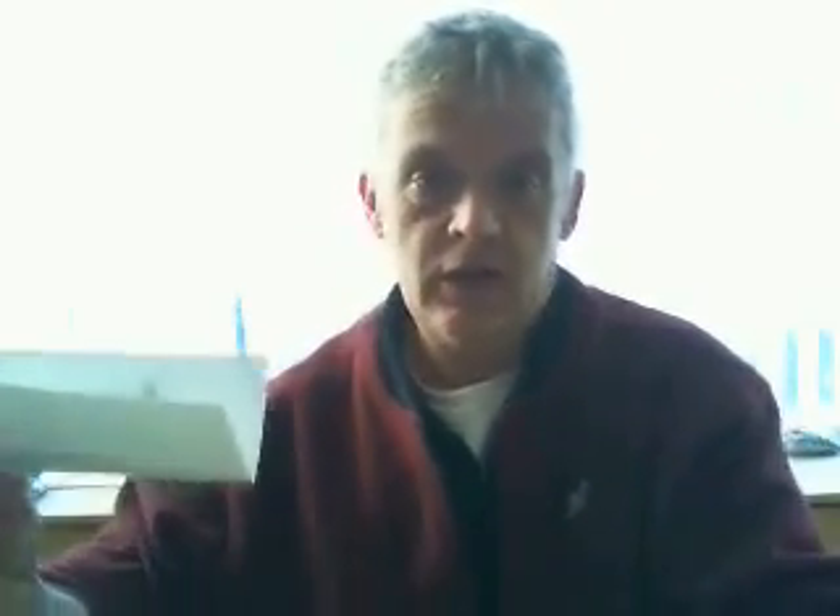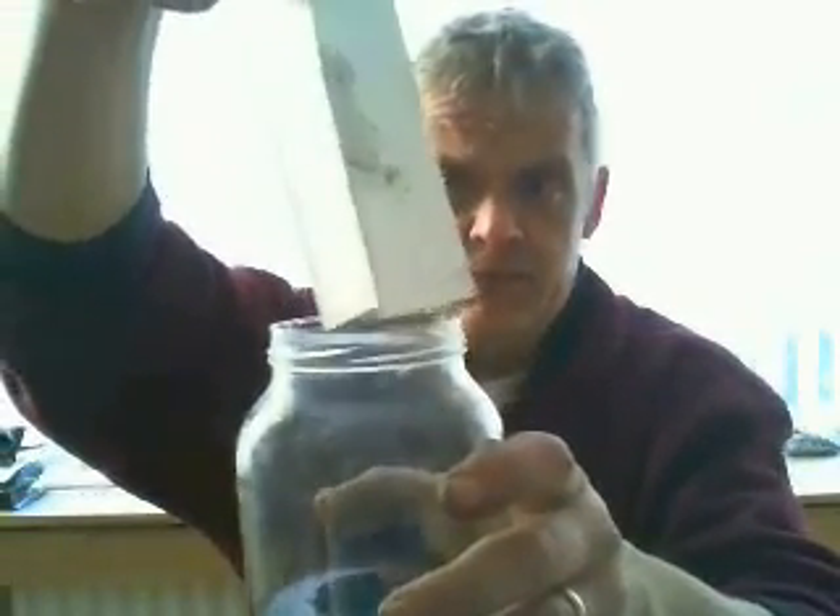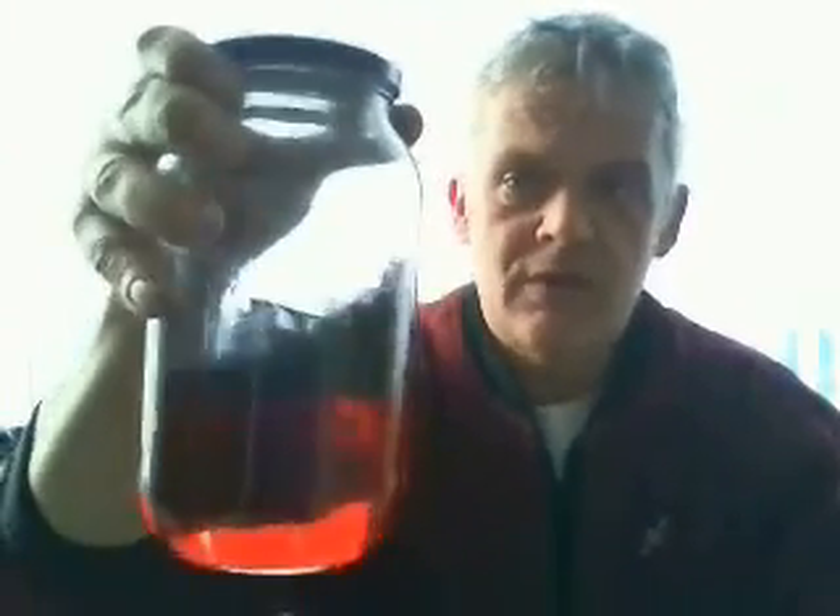The yield is about 100%. What I've got in this jar is 320 milliliters of concentrated sulfuric acid at 98%, and 80 milliliters of phosphoric acid at 75%. What you do with this is just add 3.2 grams of graphite. The graphite to sulfuric acid ratio is 100 to 1 if you want to vary it, and you can literally just pour the graphite in and give it a swirl around.